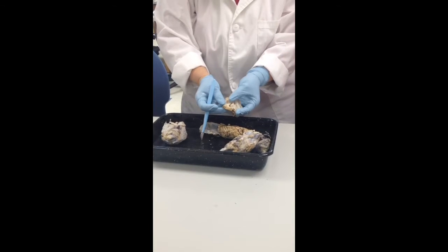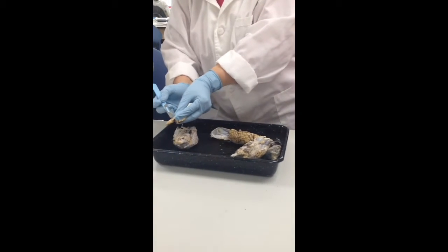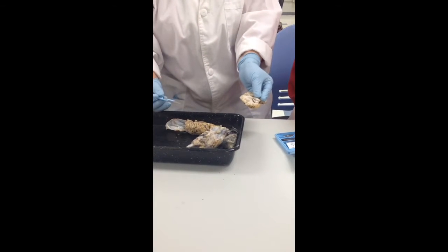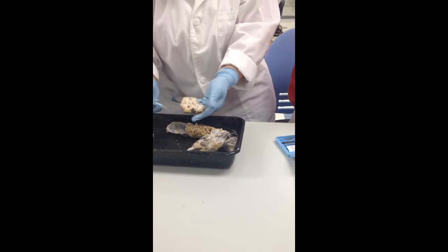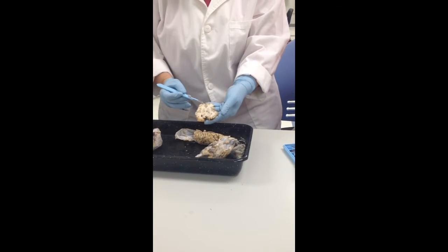And you can even see some choroid plexus. Notice all that black webby stuff? That's what does the choroid plexus make? CSF. Now, if you guys remember, I told you that in the brain you have organized gray matter, white matter, gray matter.